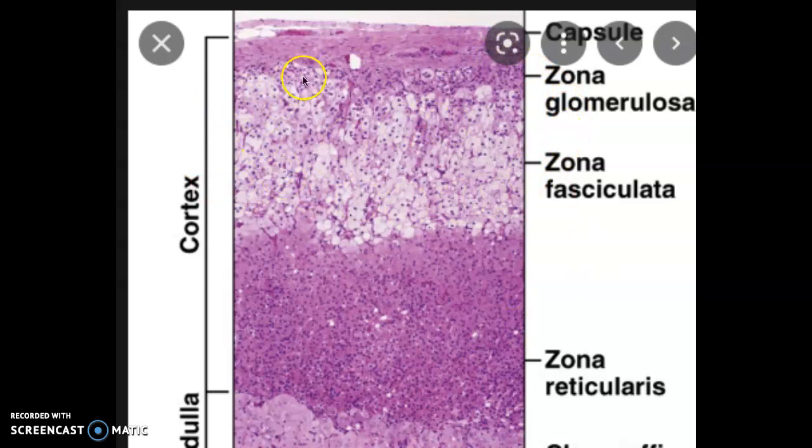And another strategy is to always go for this nice clear zone, and you know the other two zones, which is the fasciculata, and you know the glomerulosa is above it, reticularis is below it.